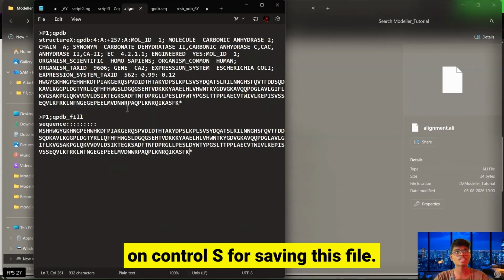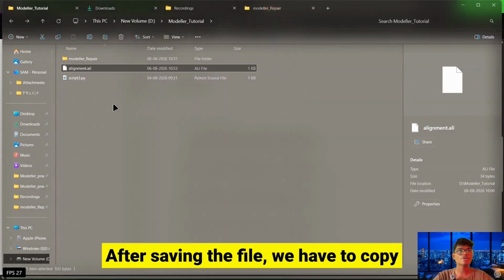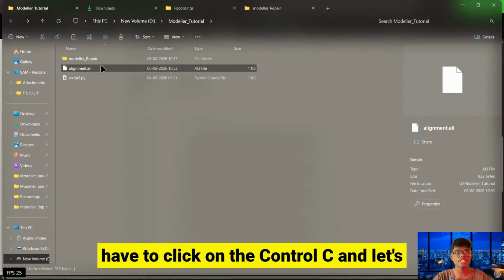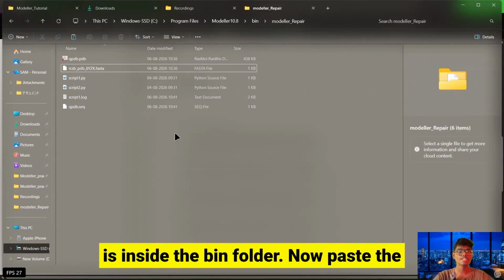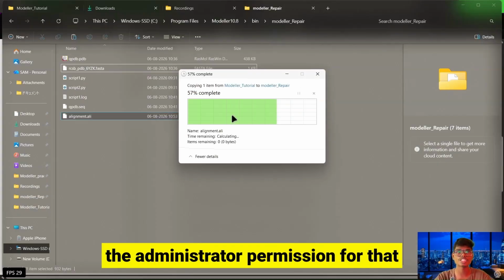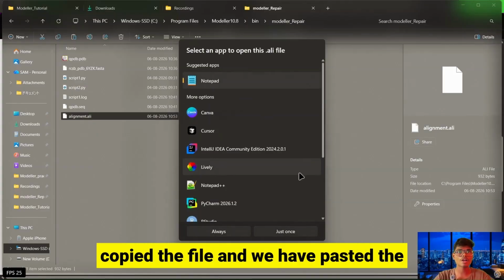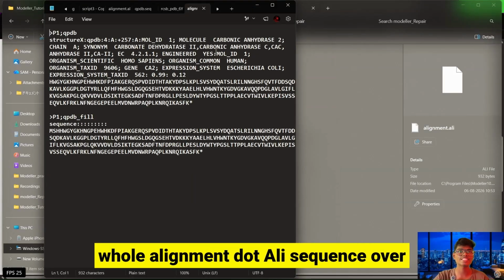Now click on Ctrl+S for saving this file. After saving the file, we have to copy this file to the bin folder. For that, we click on Ctrl+C, and let's move to the modeller repair folder, that is inside the bin folder. Now paste the ALI file over here, and we have to give administrator permission for that too. Hence we have copied the file and pasted the whole alignment.ali sequence over here.